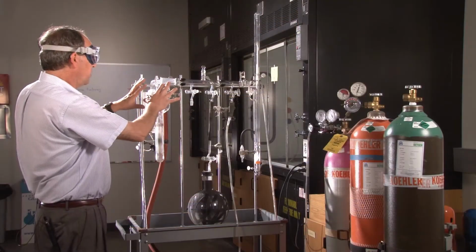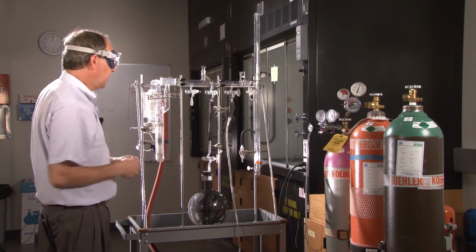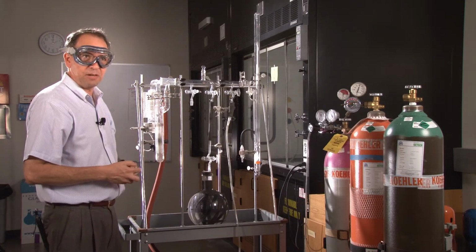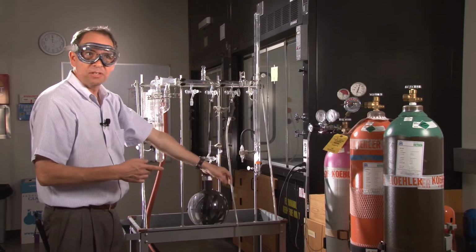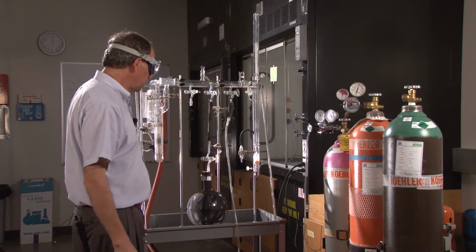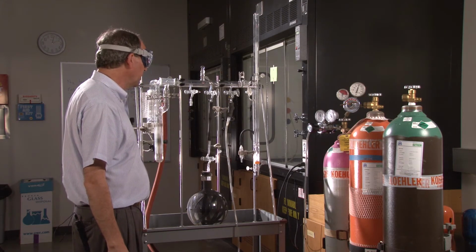Now we have the entire system under vacuum, and so now we're going to shut this valve, and we're going to open up the valve on the carbon dioxide tank in order to fill the manifold with carbon dioxide at atmospheric pressure. And this is going to go back down. Now as it gets low, I'm going to get down to the level of the mercury and make sure that the level on the inner tube is the same level as the level in the little pool at the bottom of the manometer.